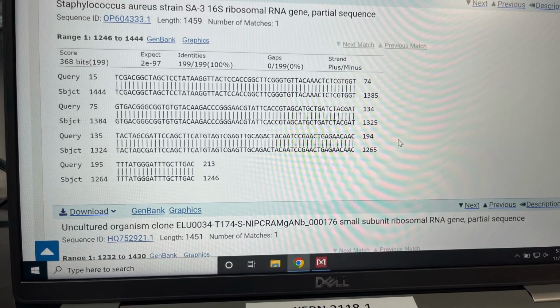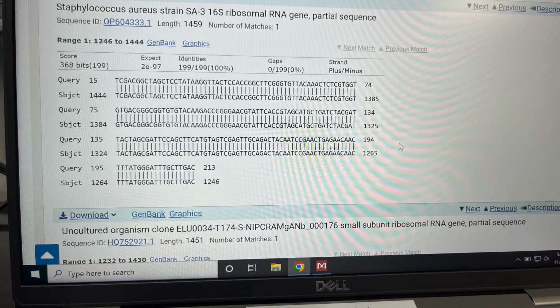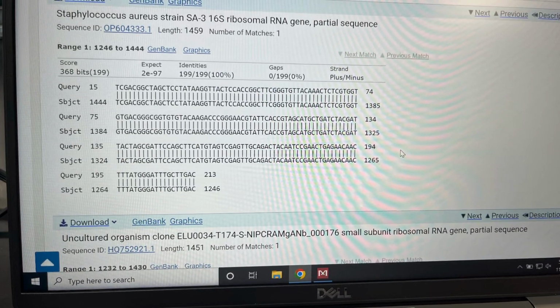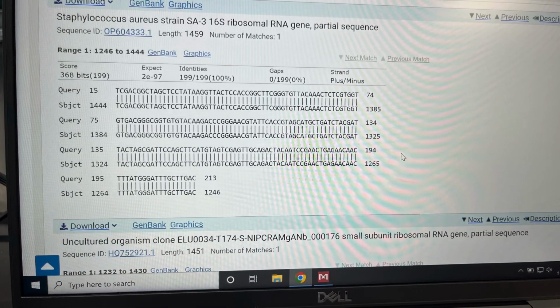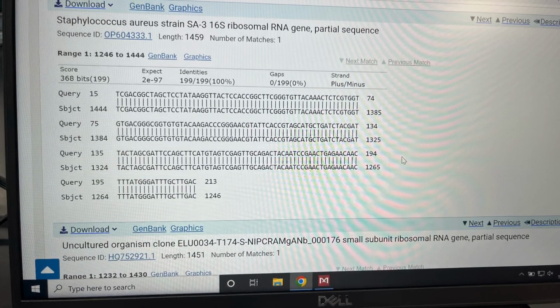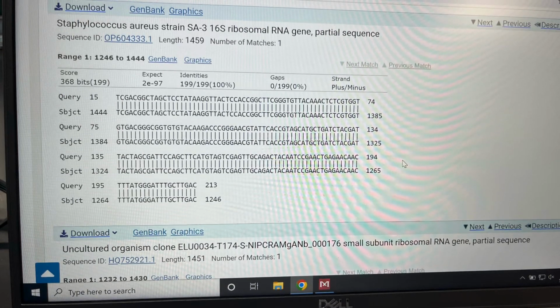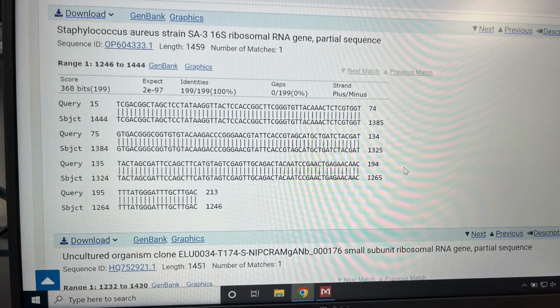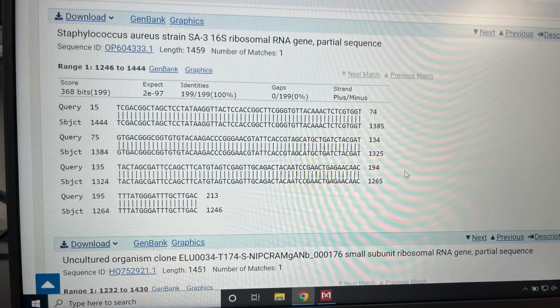Okay, so to start, you are going to open your computer and download and open the Mega X. And then after this, you're going to open the files in Canvas and examine the chromatograms. You're going to scan through your chromatogram and find bases that have been labeled N. And this means that the software couldn't make an automatic call.